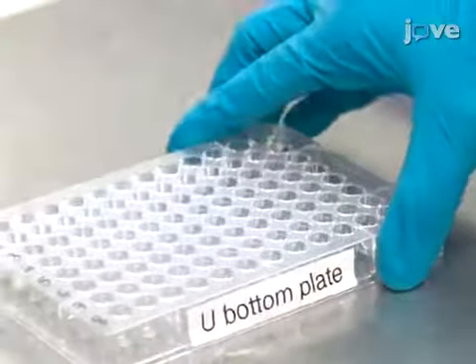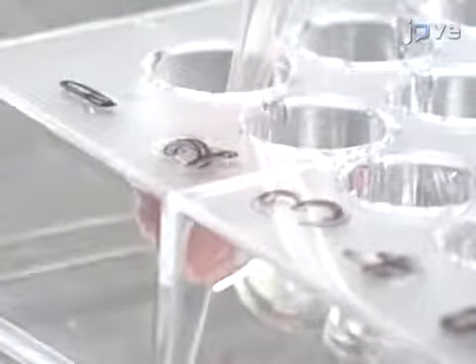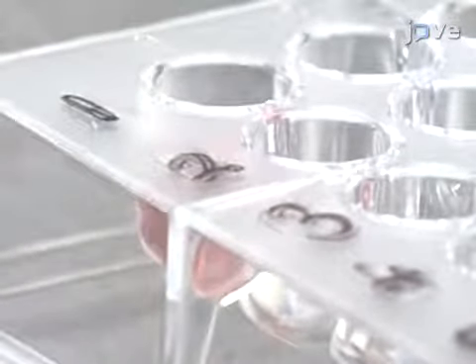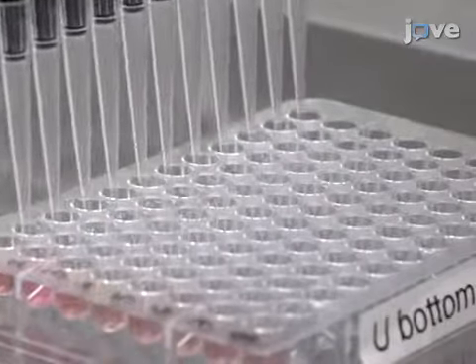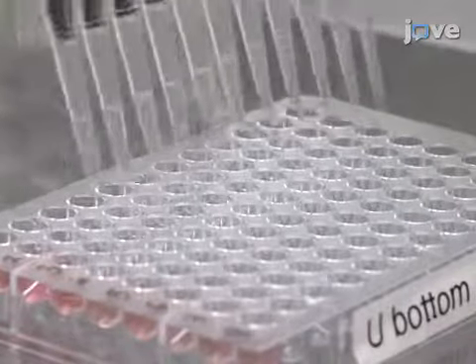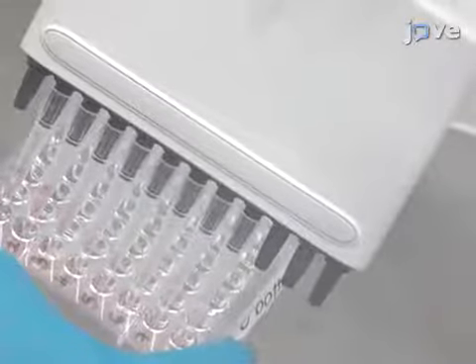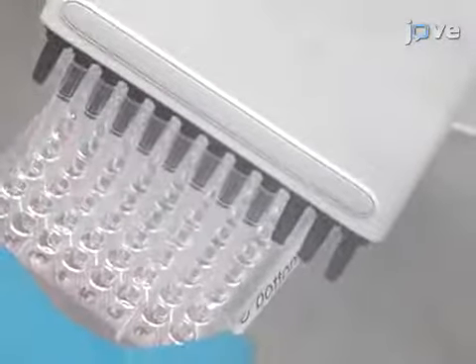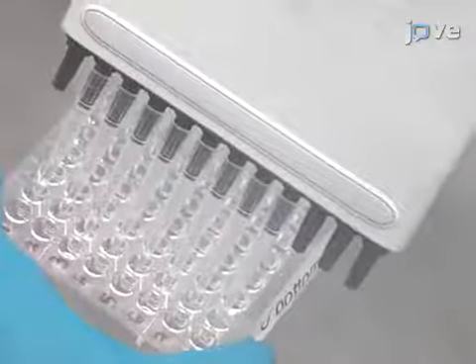Beginning with a 96-well U-bottom plate, dispense 120 microliters per well of undiluted cultured influenza viruses into column 1, and 60 microliters of 1 times assay buffer containing 0.1% NP40 into the remaining 11 columns. Using a multi-channel pipette, serially perform twofold dilutions across the plate, leaving column 12 as a blank containing only 1 times assay buffer.